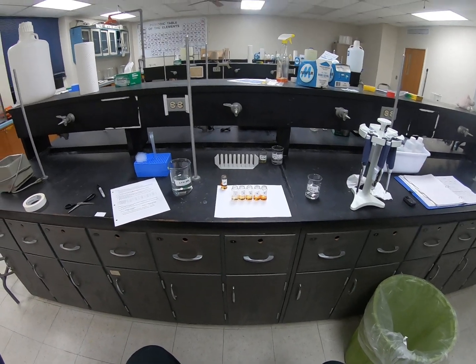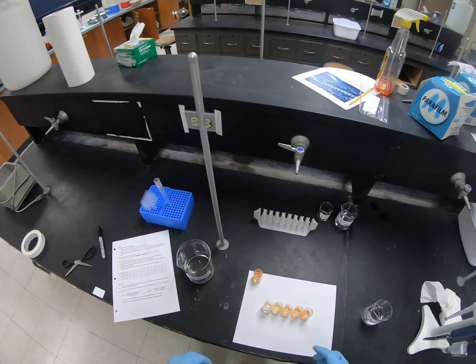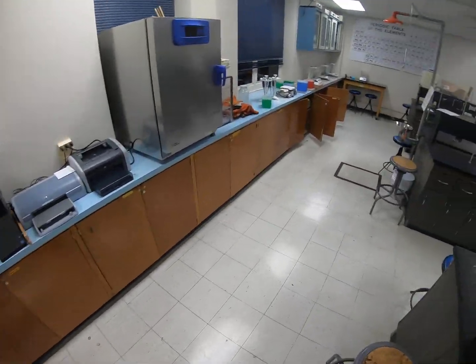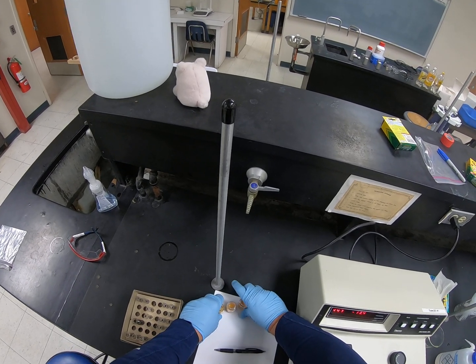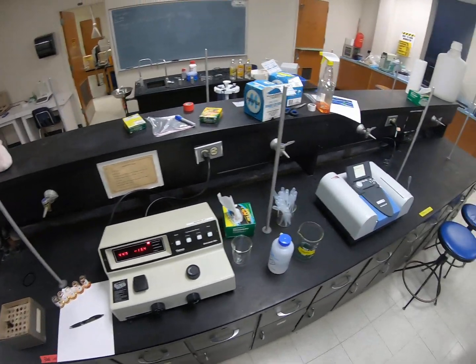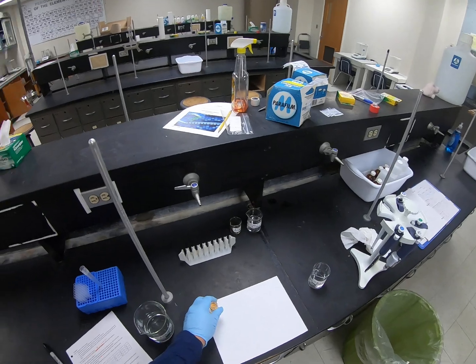I'm going to check my camera right quick, make sure it's still recording. And it is. So now we're going to go over to the instrument and we're going to try to record some data. So I'm going to take these to the other side with the instrument, and this is our Spectronic 20, and then we have a newer version of it. So the lab says that we're going to use this guy. This is the Spectronic 20, and then I'm also going to show you a newer one. So I've got one more sample to pick up. So let me get this standard.